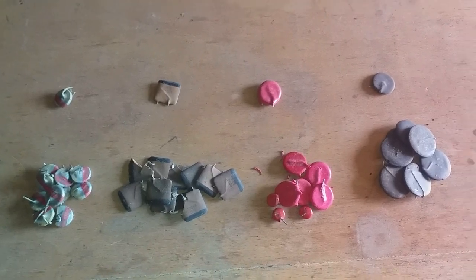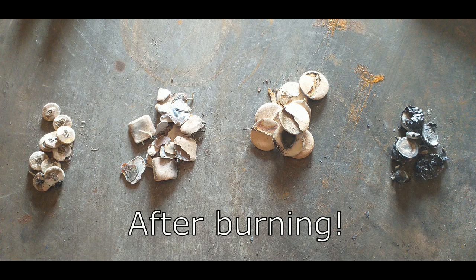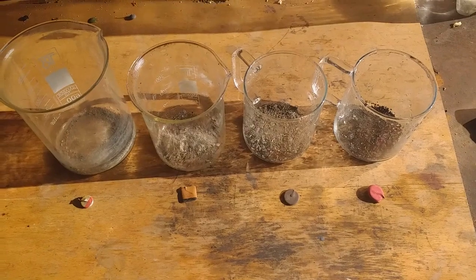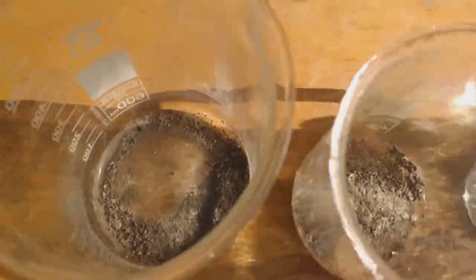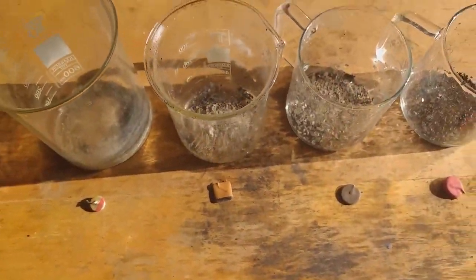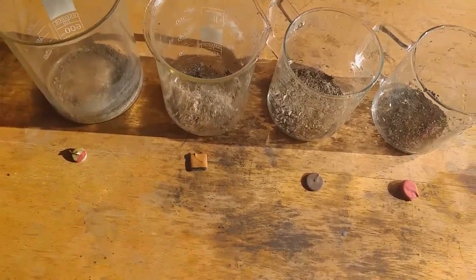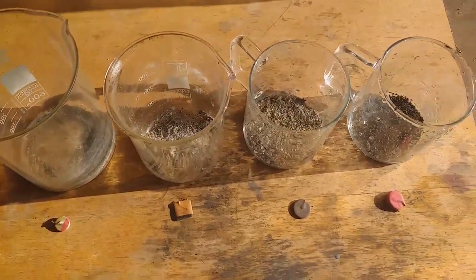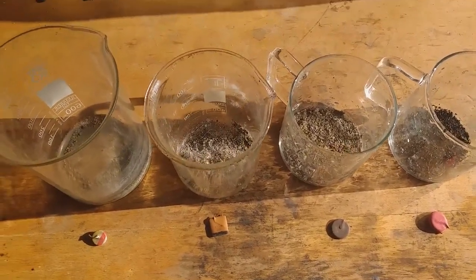For today, we have our main material. So let's start. So right now I've crushed all those capacitors in these beakers — see that? And these are the samples. So right now I will add to each one a clean nitric acid, just a little bit, enough to dissolve all the metal. And at the end, after filtration, I will drop a stannous test to see if there is any noble metal in these capacitors.